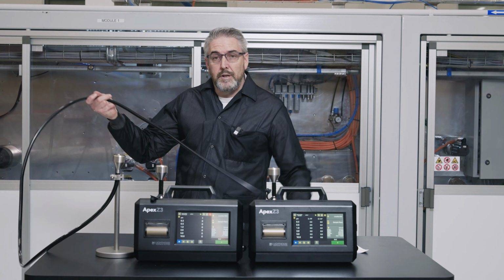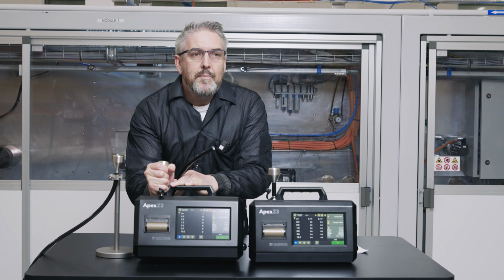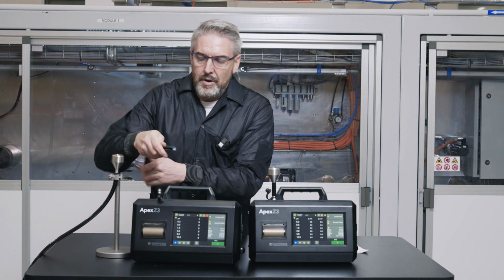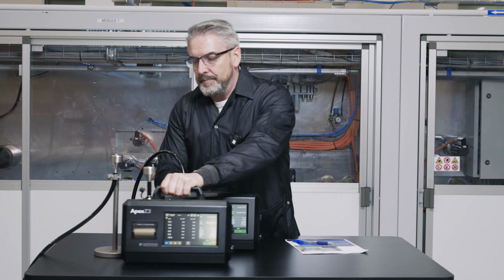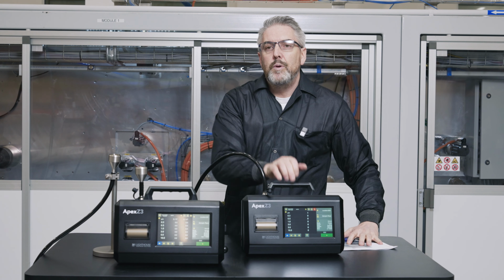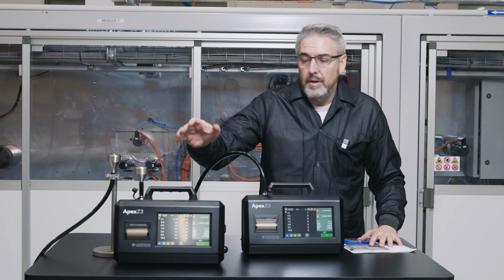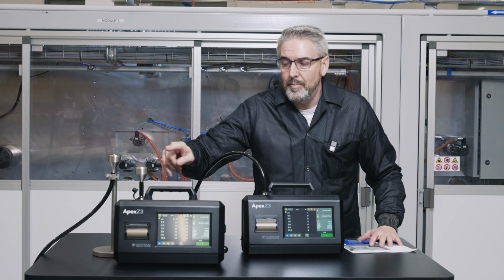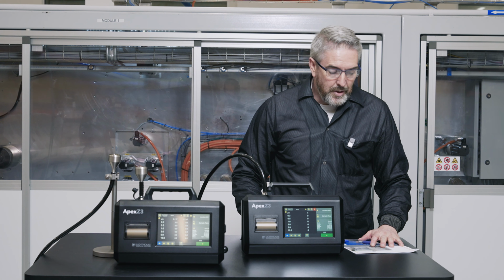Part two of the test, we're going to take the sampling system and connect it to one of the particle counters, and as you can see, tubing, lots of bends. And we're going to then run the testing again of the two instruments, side by side, with the sample probes very close to each other. And we're going to look at the ratio of the particle losses between the system without the long length of tubing with the direct sample probe connected, and the system here, the particle counter, with the long length of tubing.